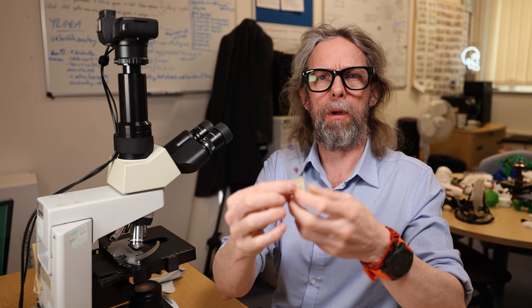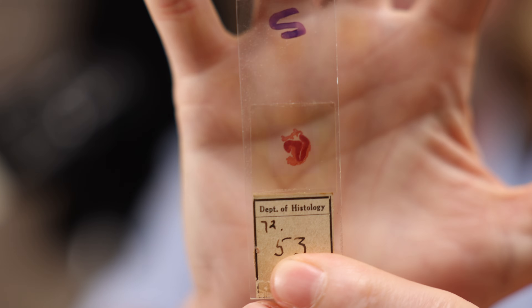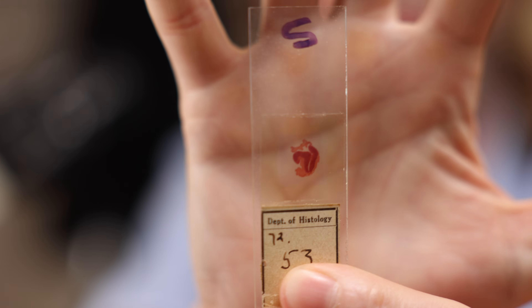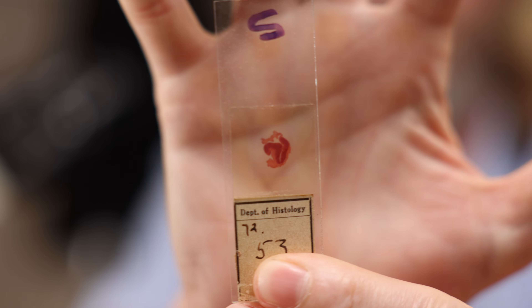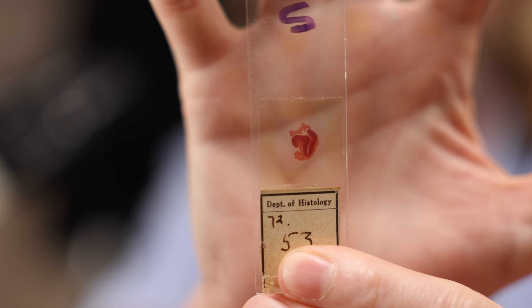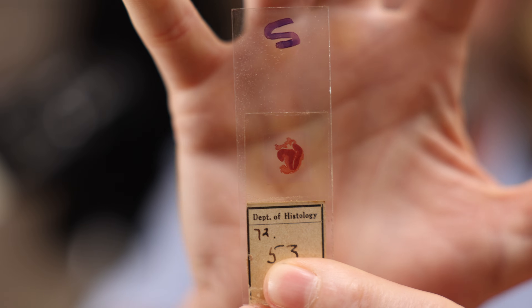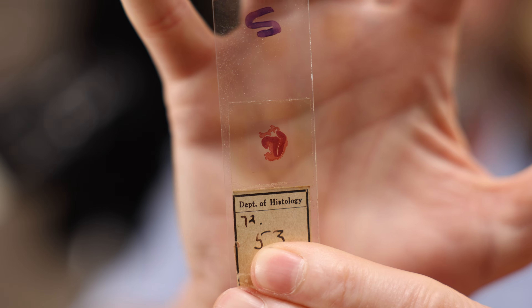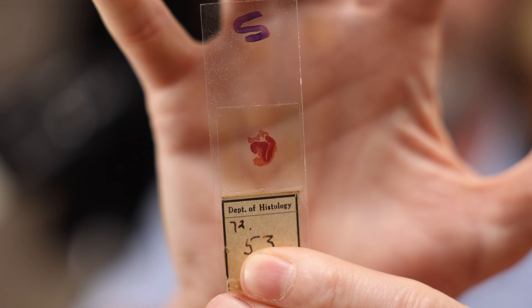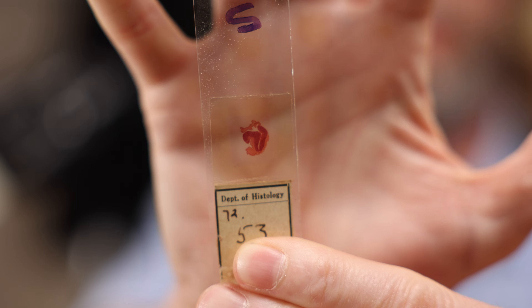I think we might be able to see some of the main features of the tonsils that cause those problems. We can see a crypt — can you see that infolding? There's some darker staining tissue and some redder staining tissue.